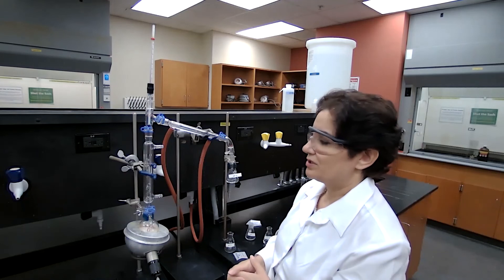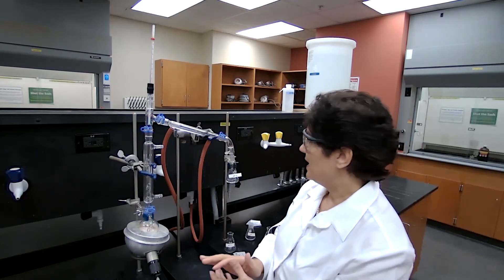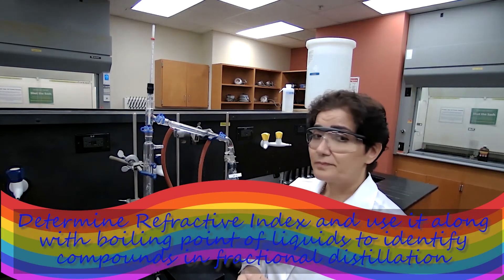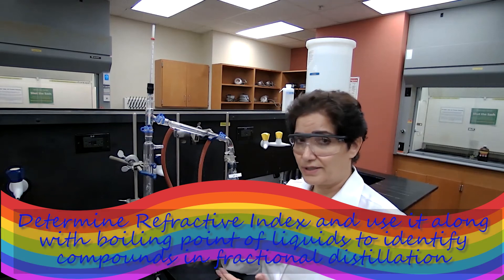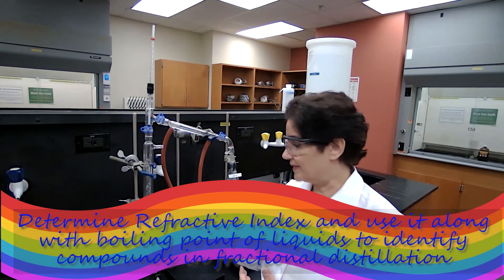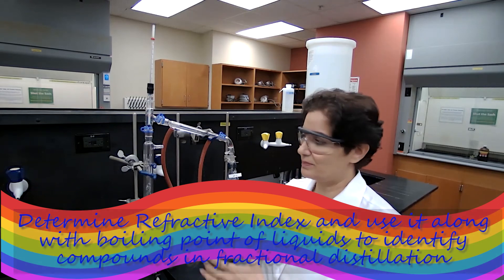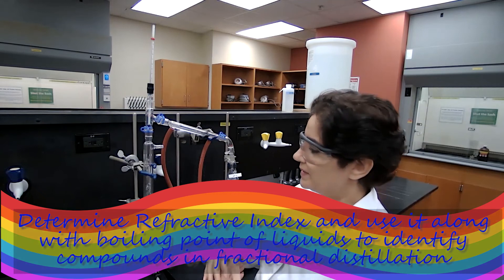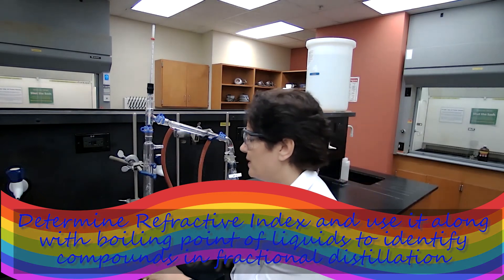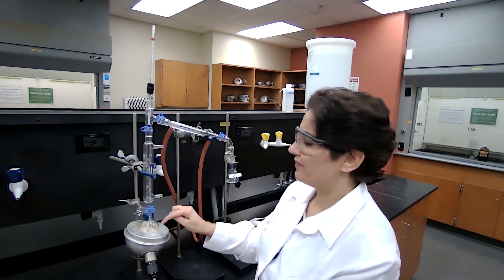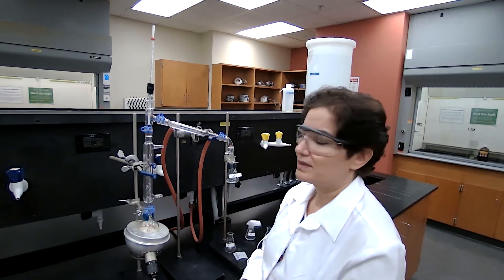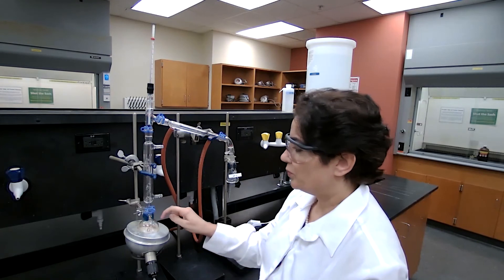And we are going to continue with the analysis of the liquid, but distillation at this point, it would be stopped because we don't have a lot of liquid left in the boiling flask. Thank you.